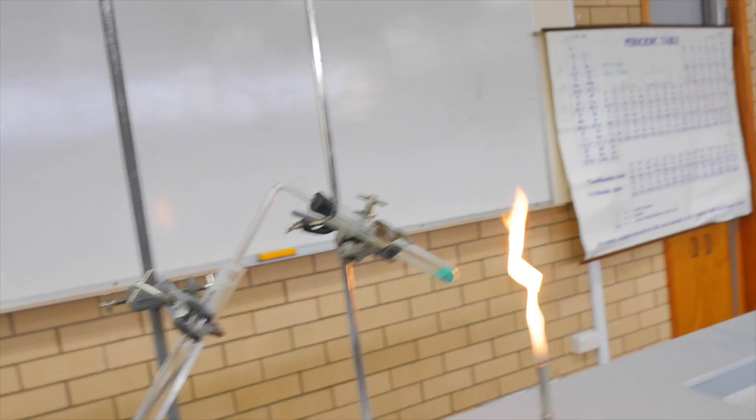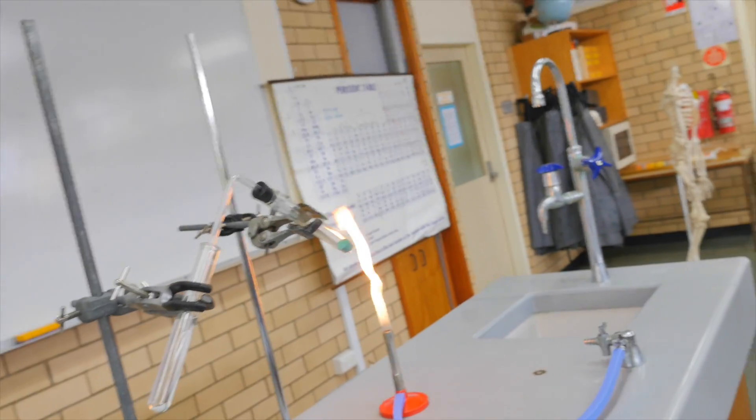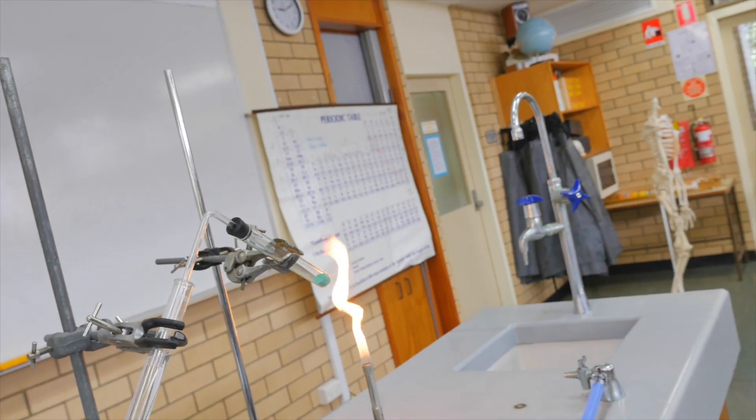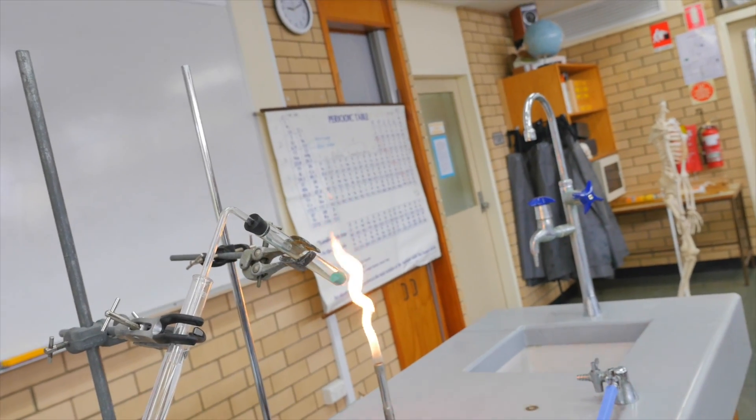Now, some people said carbon dioxide and I think that maybe they're right. How can we tell if we're creating carbon dioxide? It's colorless. Alright, that's difficult to tell. We can see bubbles maybe.